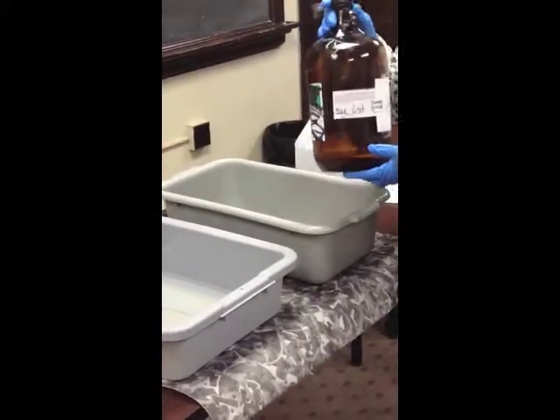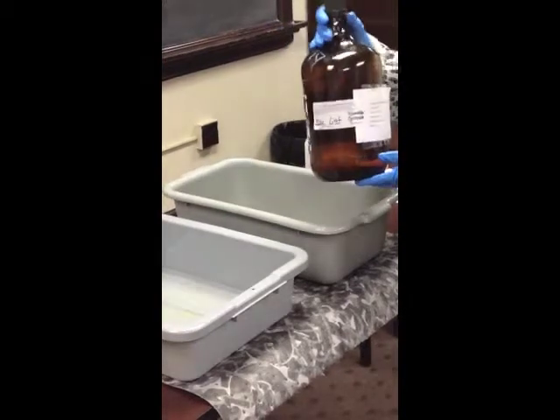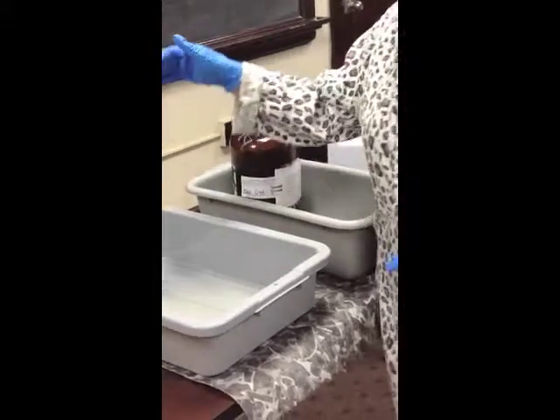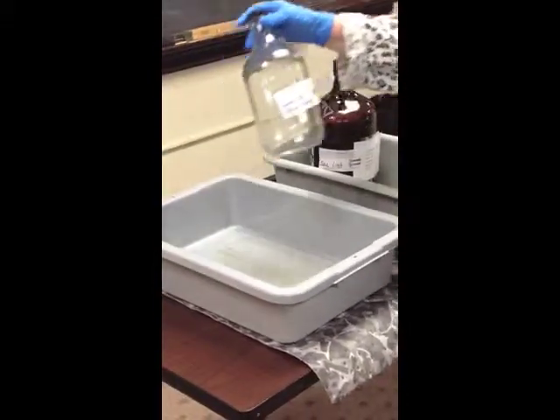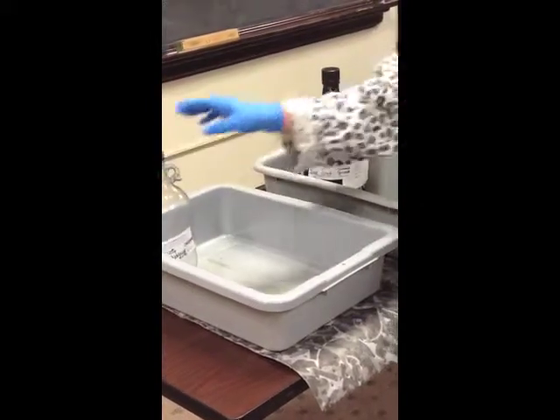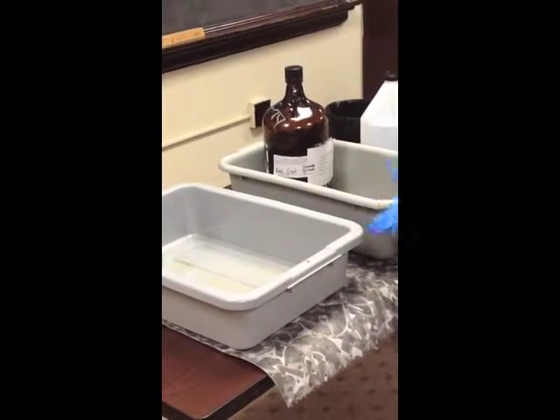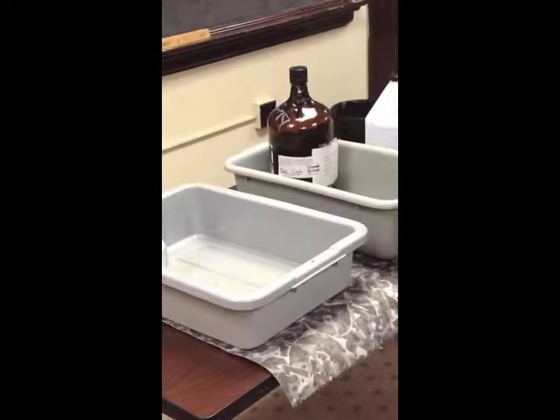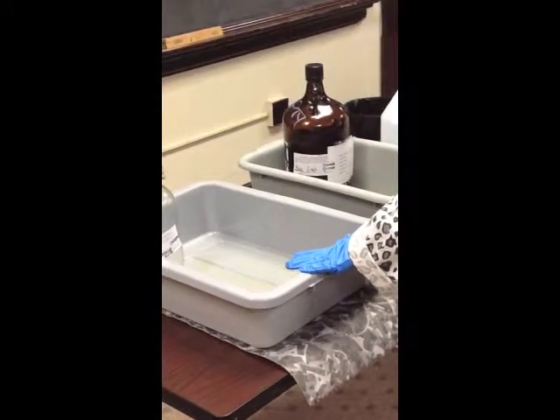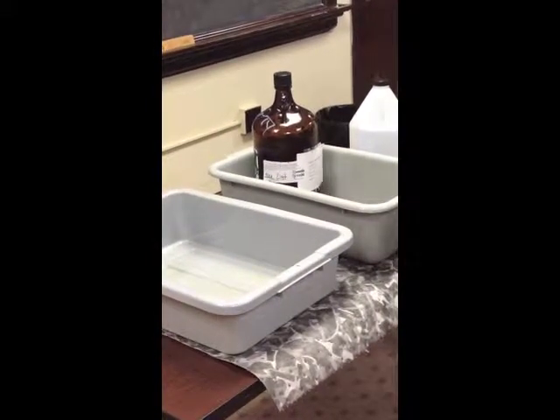This container has flammable acidic solution. It has acetone, acetic acid, toluene, and sulfuric acid with water. It is a flammable acidic. As I said, this one has sodium hydroxide in water, which is a basic corrosive. Those two are incompatible, so we need to make sure they're separated so that if one or both of the containers leak, incompatibles do not mix together. So we have separate lab packs that we put our hazardous waste in according to hazard categories.